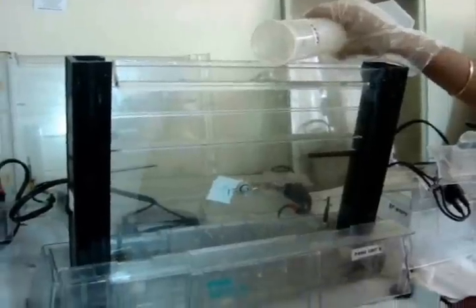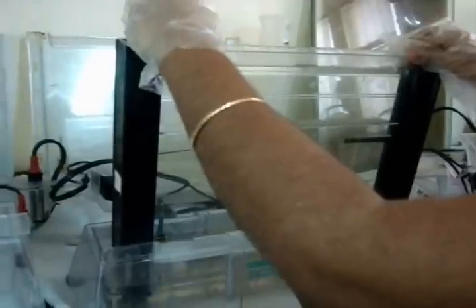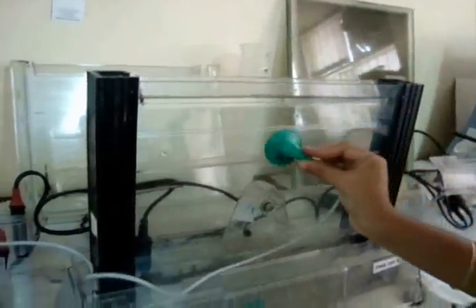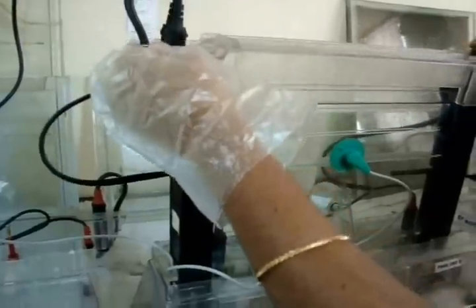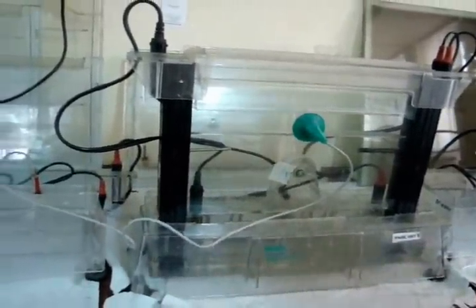Acrylamide gel electrophoresis is performed, in which the gel for AFLPs is run. The gel is run and the sample is viewed using the silver staining procedure.